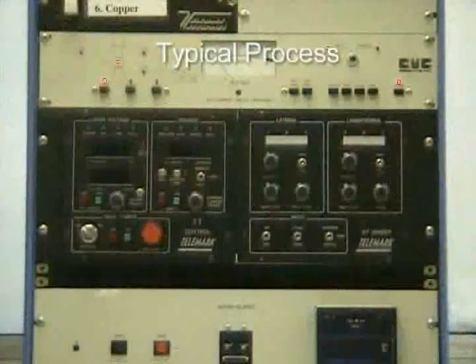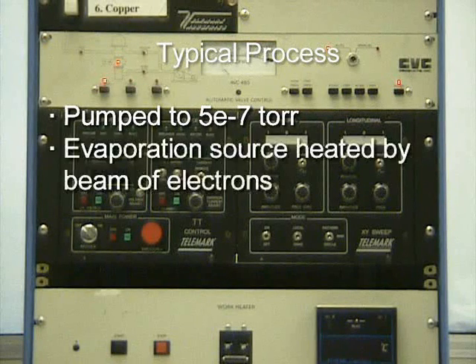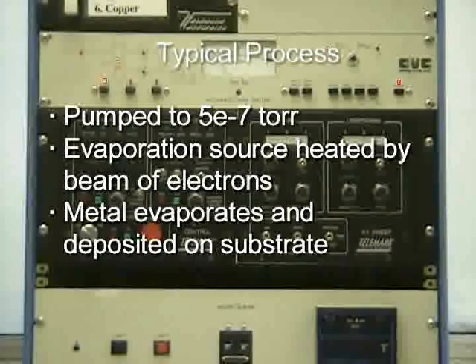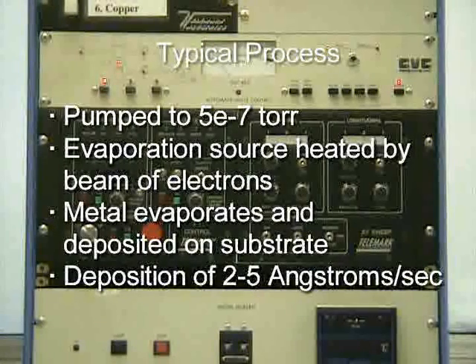In a typical process, the chamber is pumped down to a pressure of 5 times 10 to the negative 7 torr to prevent air molecules from interrupting metal atoms as they travel from the evaporation source to the substrate. The metal evaporation source is then heated to a high temperature by a beam of electrons. This causes the metal to evaporate and be deposited on the substrate. Typical deposition rates range from 2 to 5 angstroms per second.